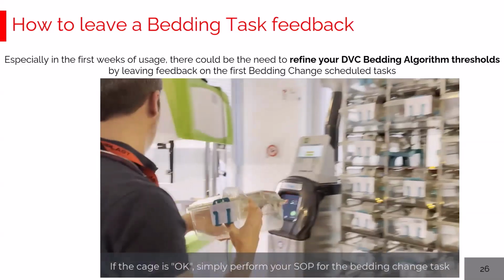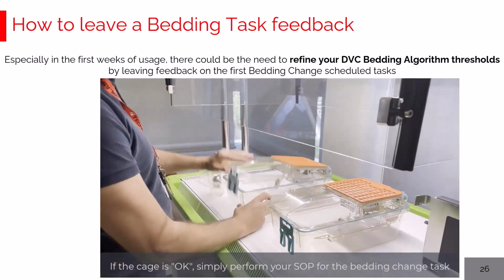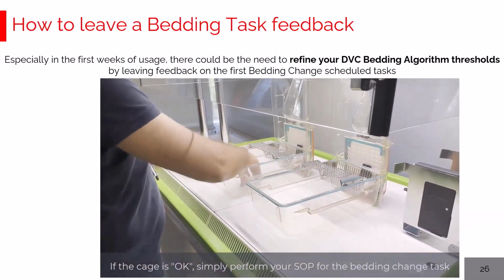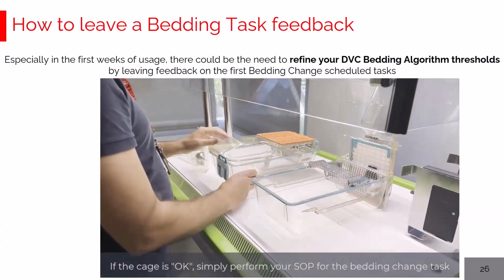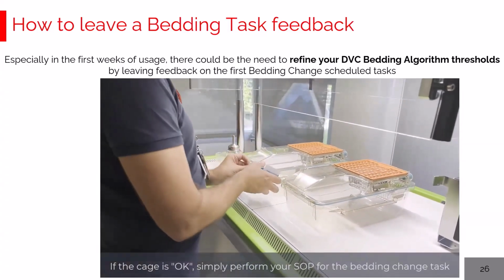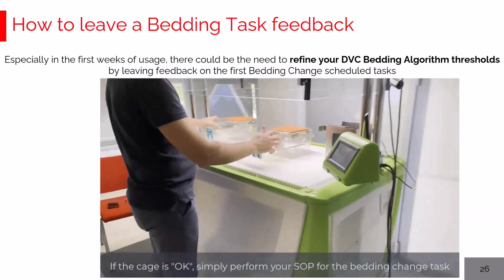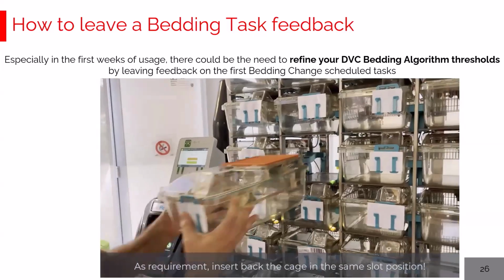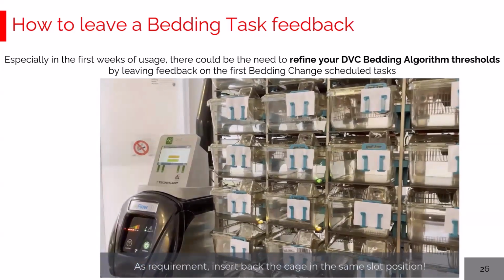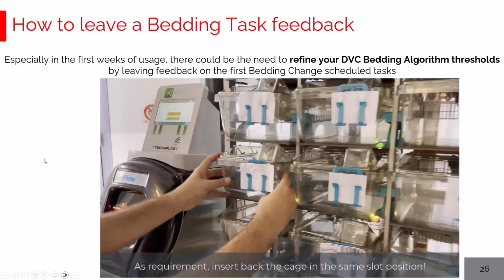In this case, the cage is dirty enough for your evaluation, and you can proceed by performing the standard bedding change routine you're used to doing in your facility, simply by moving animals from the dirty to the clean cage, moving also the cage label, and, as a requirement, inserting back the cage exactly in the same position. So for us, this is an okay feedback, meaning that this cage was dirty enough for you.